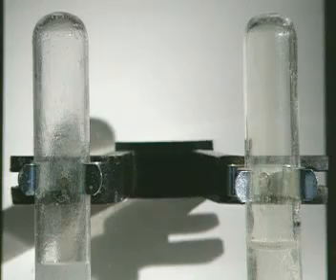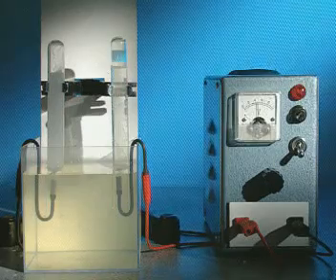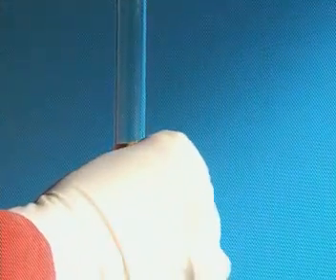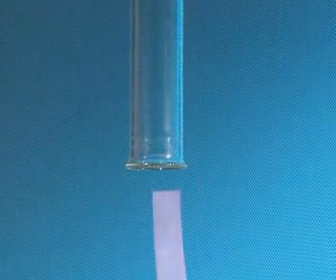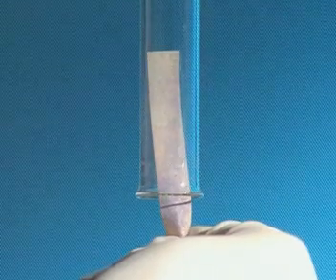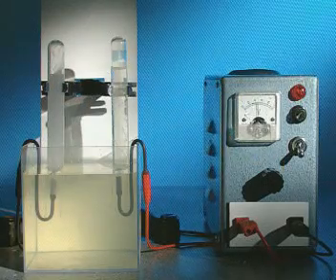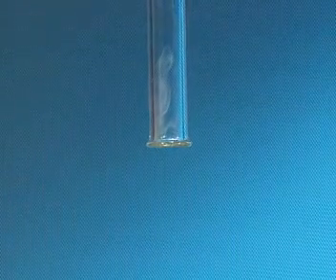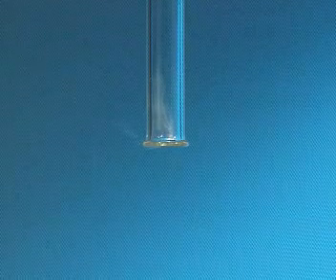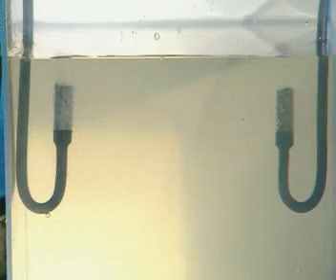Both are either very pale or colourless, but they can be identified by simple tests. The gas collecting at the positive electrode is tested with damp blue litmus paper. It goes red and quickly bleaches white. The gas is chlorine. The gas collecting at the negative is tested with a lit splint. It pops, a sure sign that this gas is hydrogen. So, why does the electrolysis of sodium chloride solution produce hydrogen and chlorine?